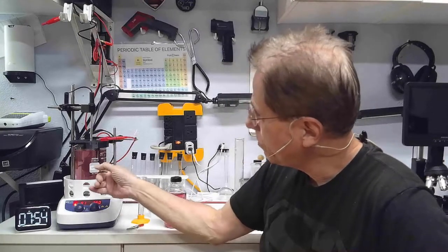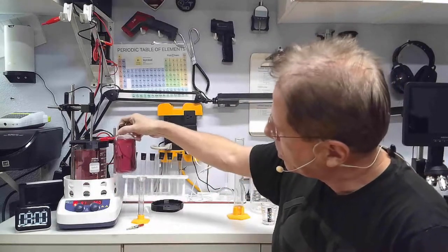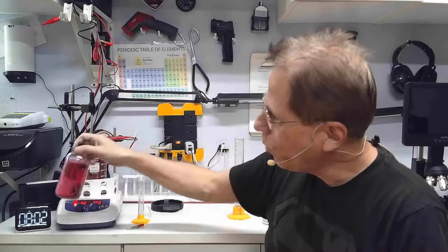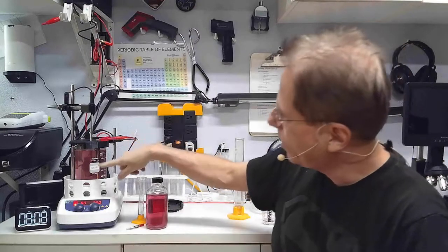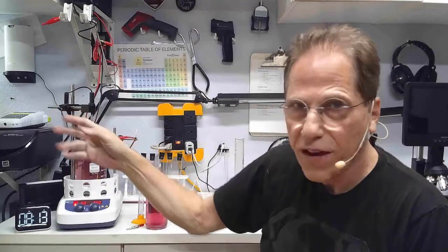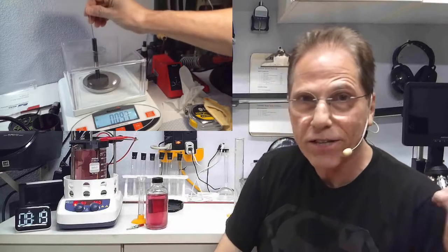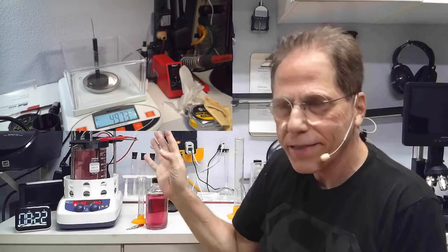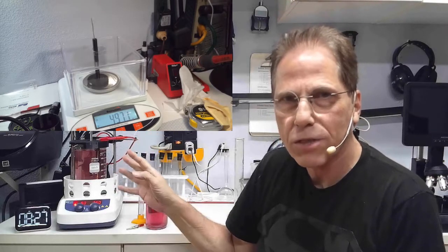As you can see, we're into eight minutes now and we're definitely getting close to this color. I know it's going to take 20 minutes, but if I hadn't been certain, I would let it get to this color and I would shut this off. Wait five minutes, weigh my rod if you got a three-digit scale to see how much material you've actually used. Your goal is six or seven milligrams of gold material to make ruby red. You might get away with eight milligrams of material, which gives you a little darker ruby red, but you're getting awfully close to orange territory.